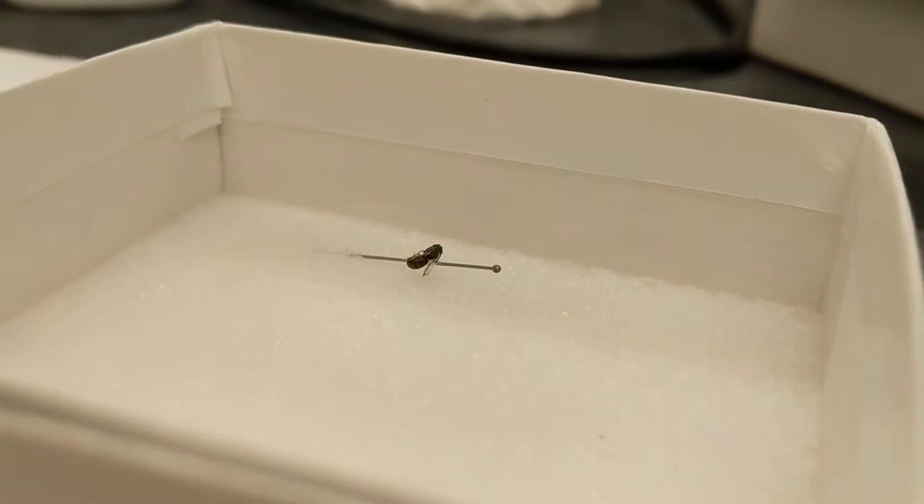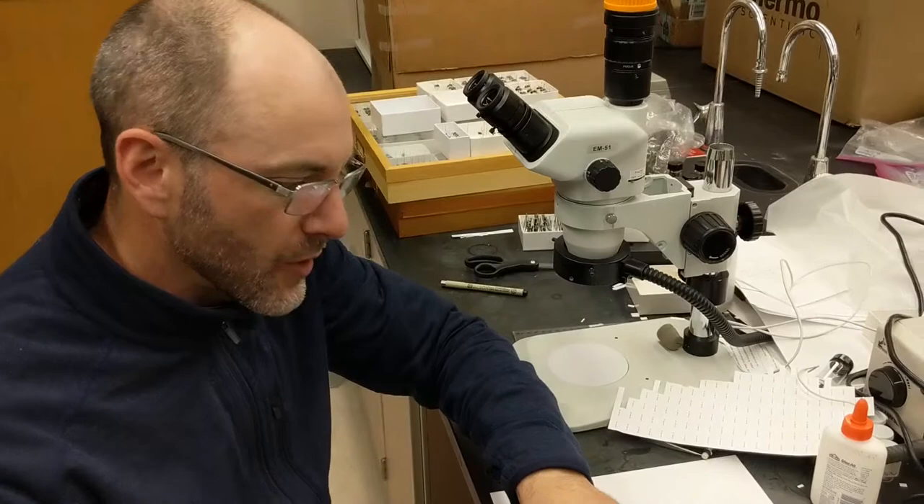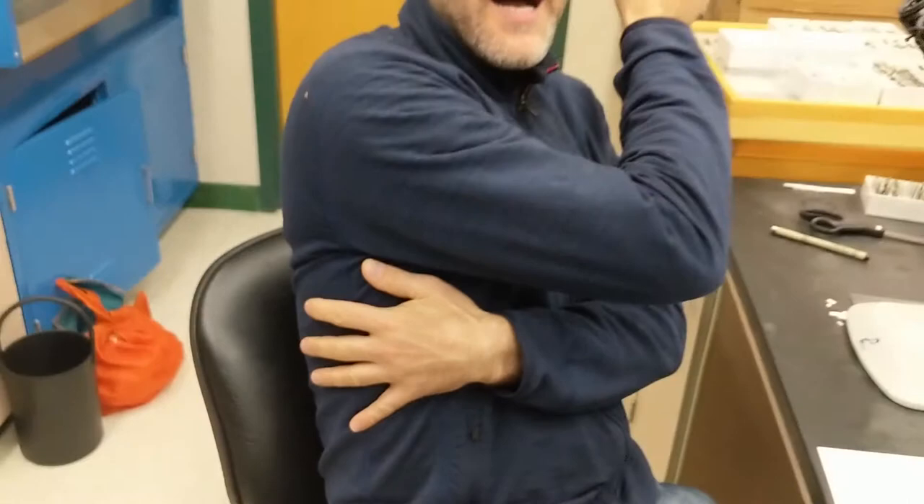Viewers should note that the glue only ever touched the specimen in that one spot. I didn't get glue all over the whole side of the specimen — I've seen a bunch of those. It's not attached on some weird angle; it's always on the right side.